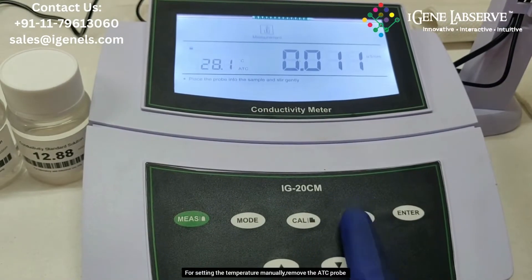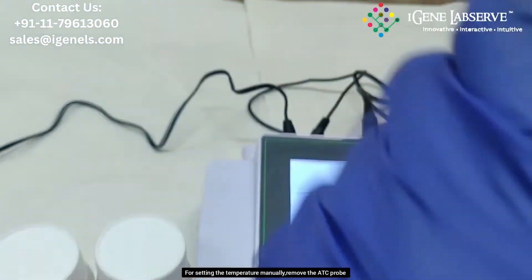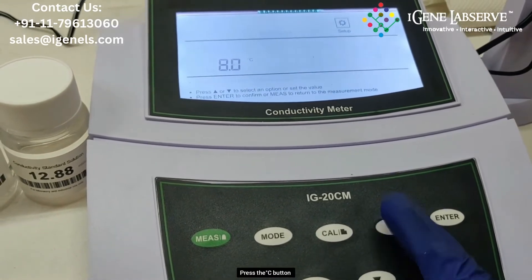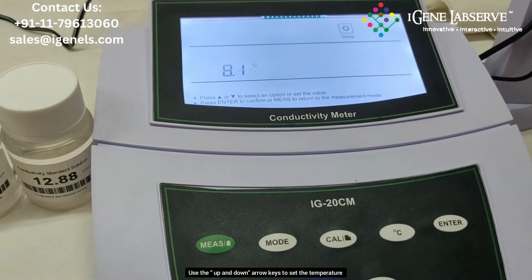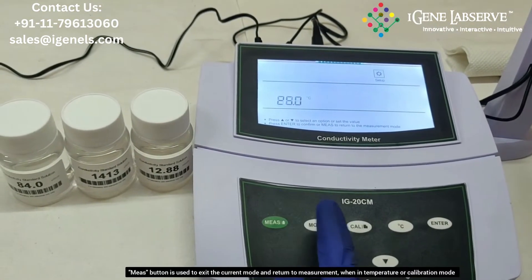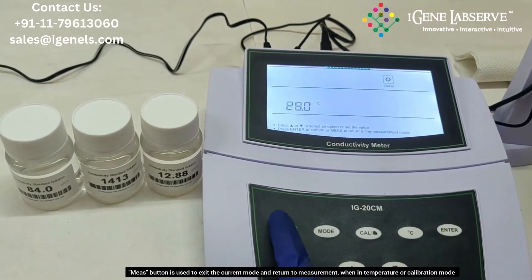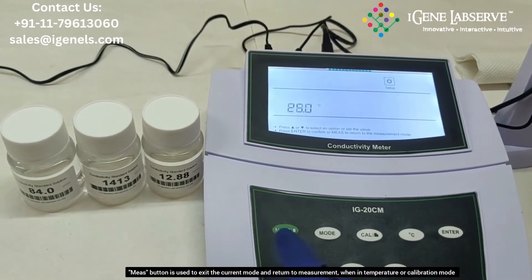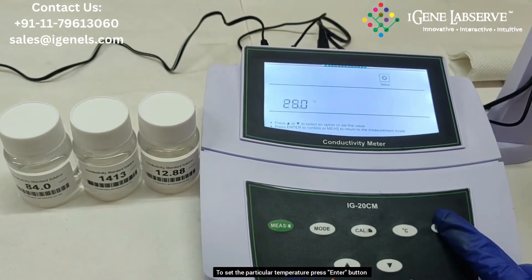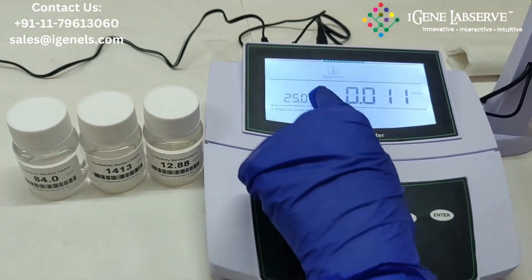To set the temperature manually, remove the temperature probe. You can set the temperature using the degree Celsius button and the up and down arrow keys. You can return to the measurement mode using the measure button when you are in any setup menu. Press enter to confirm, and it goes to measurement mode with the particular temperature set.